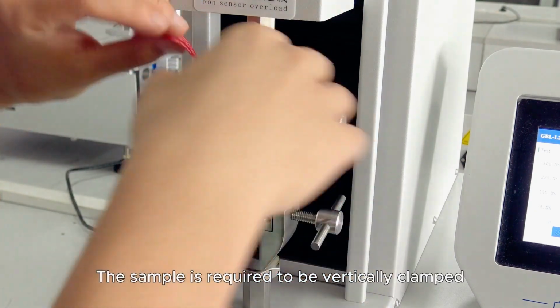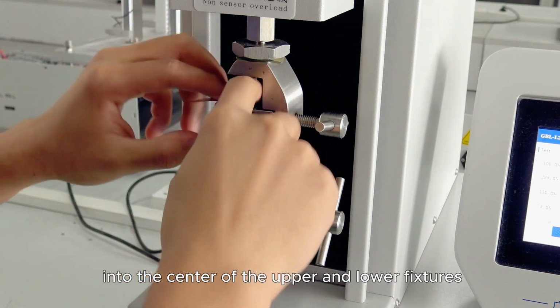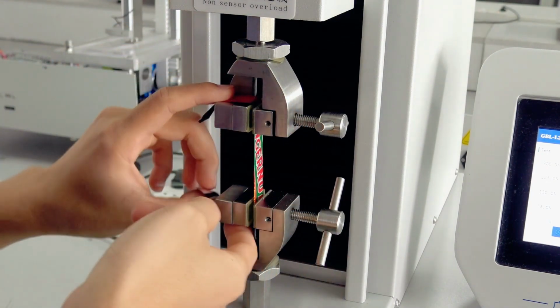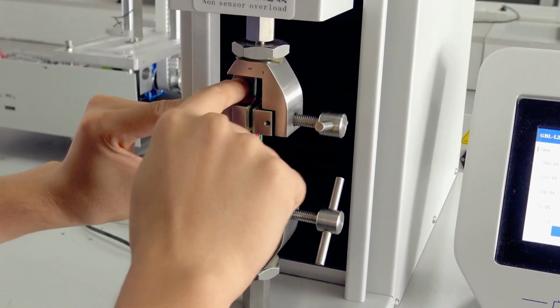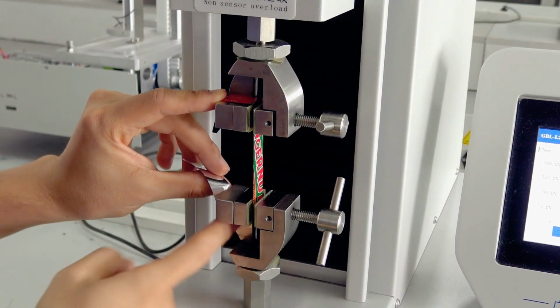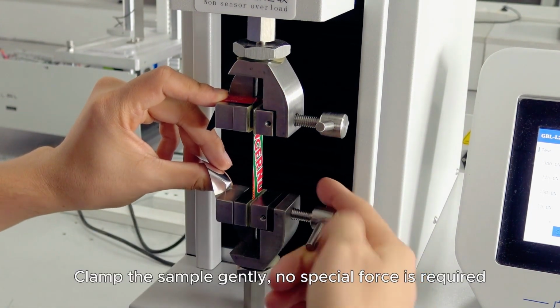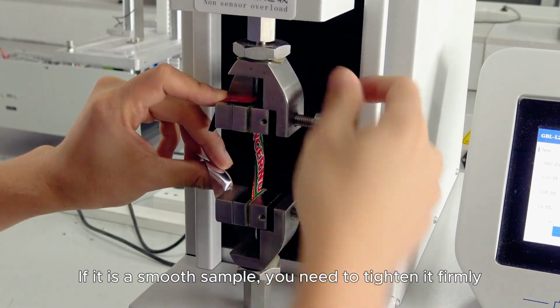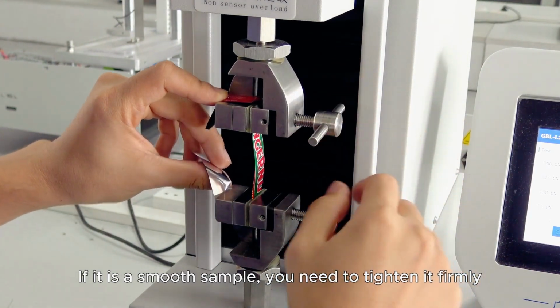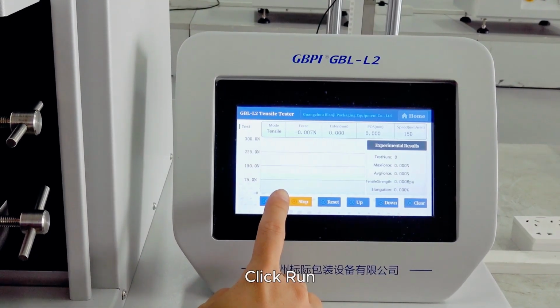The sample is required to be vertically clamped into the center of the upper and lower fixtures. Clamp the sample gently, no special force is required. If it is a smooth sample, you need to tighten it firmly. Click Run.